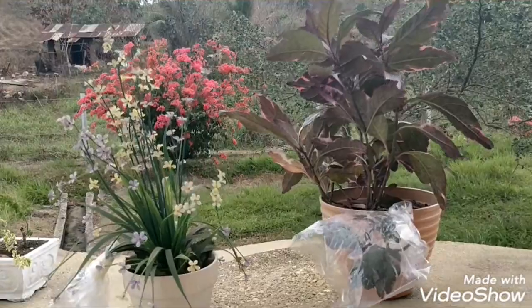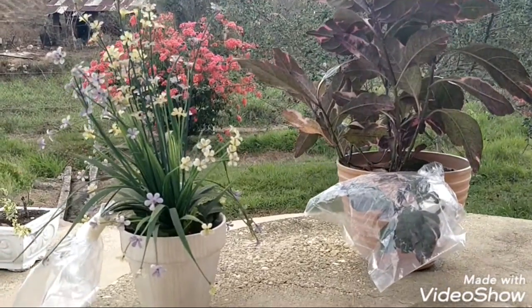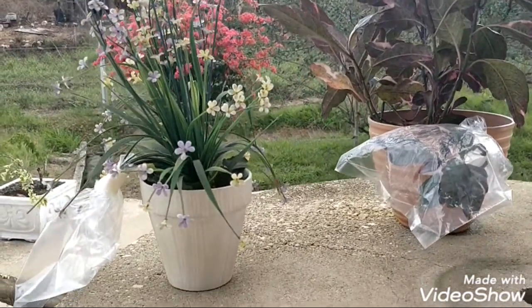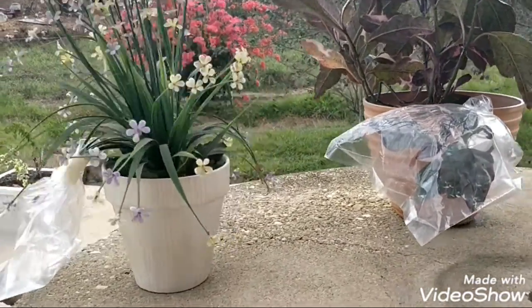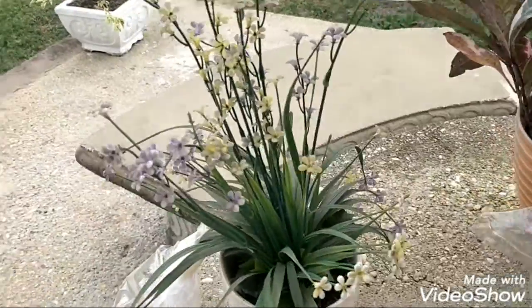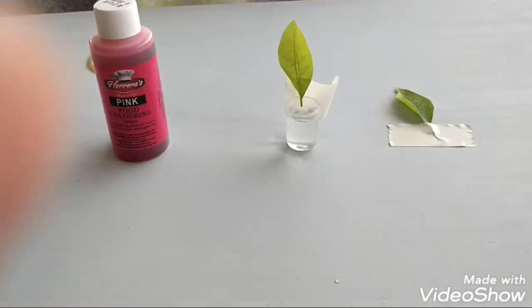So now we've got both plants out here in the sun, and we're going to leave them for about half an hour to an hour and take observations of what might be happening in the plastic bags when we come back.